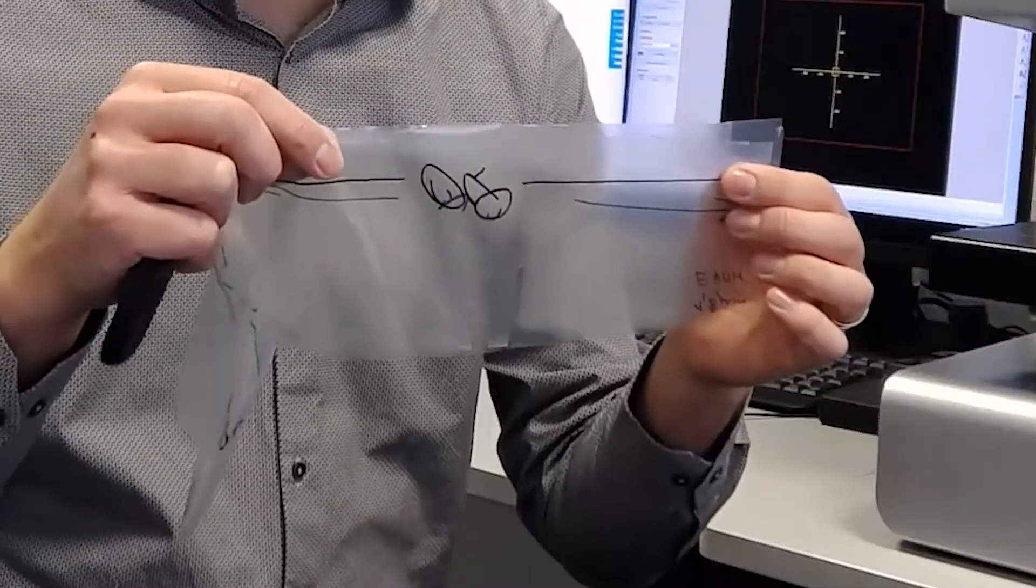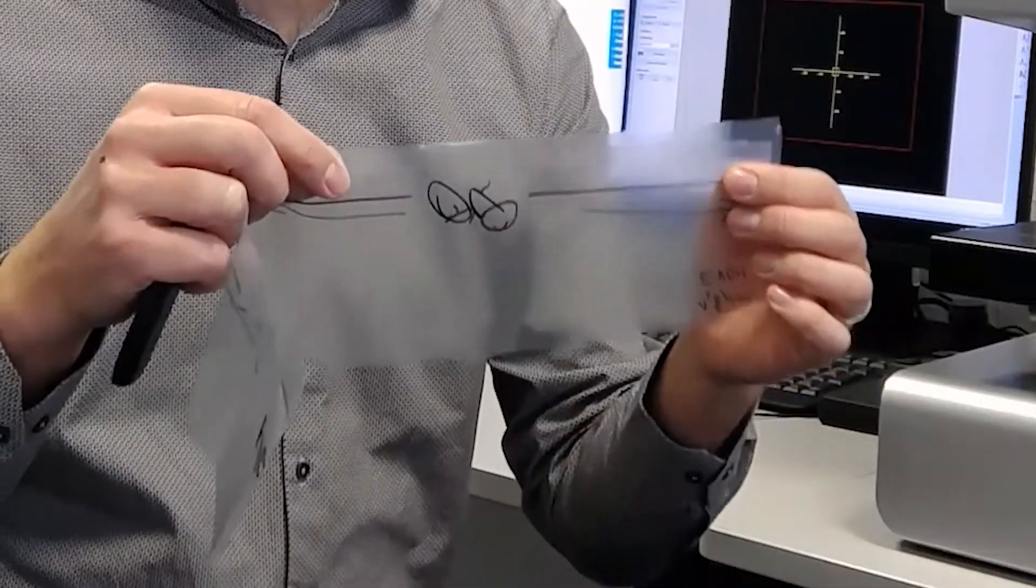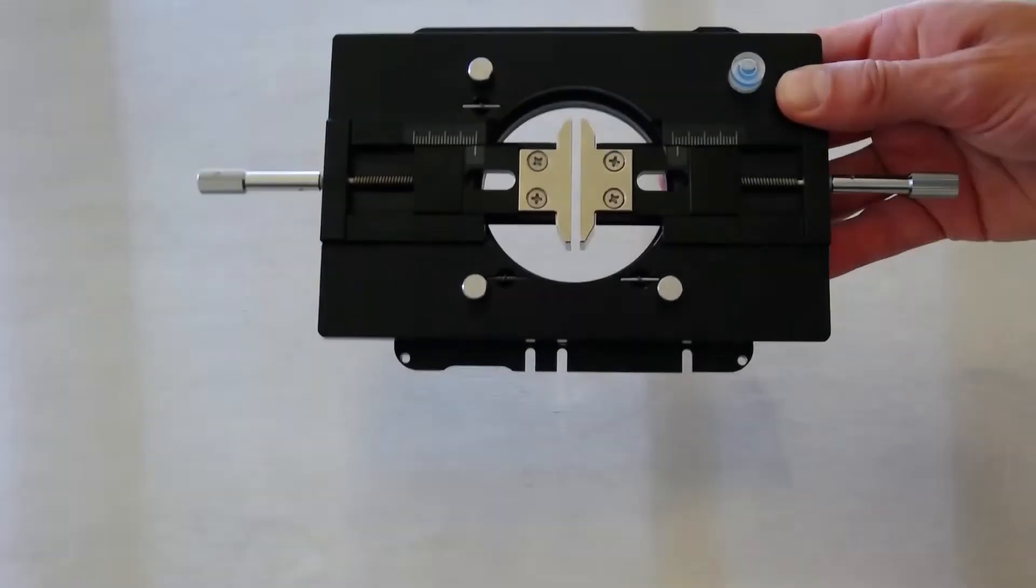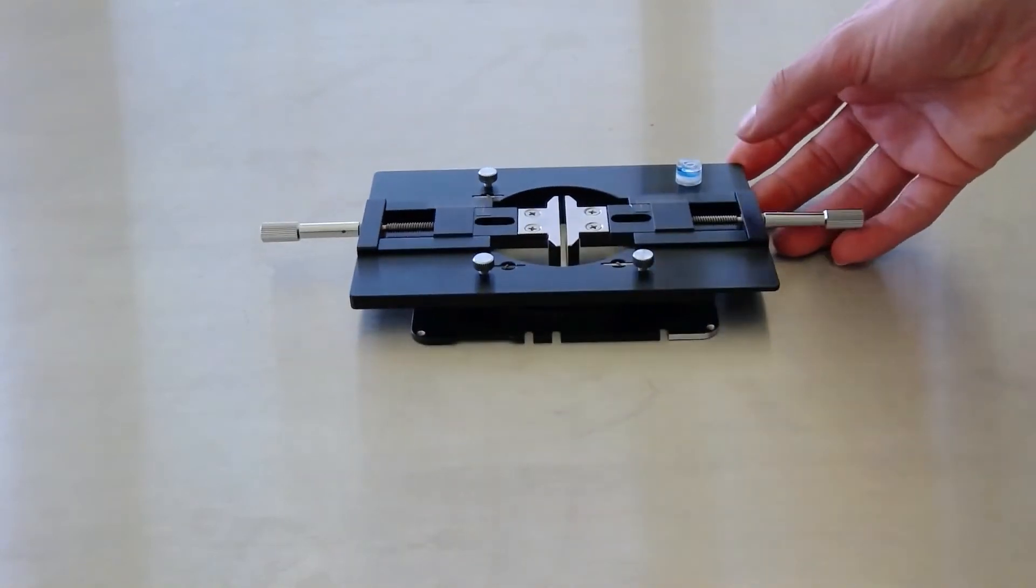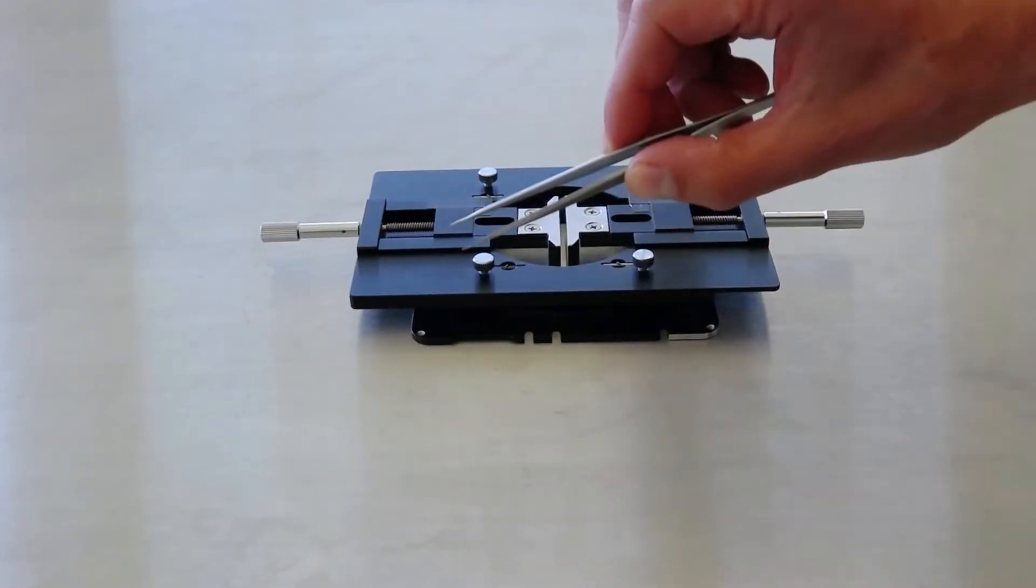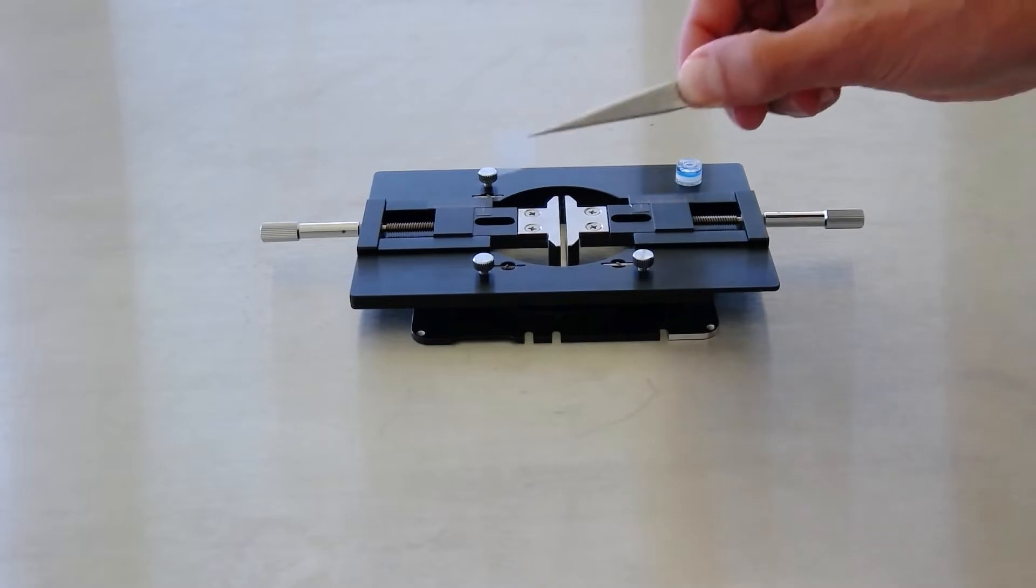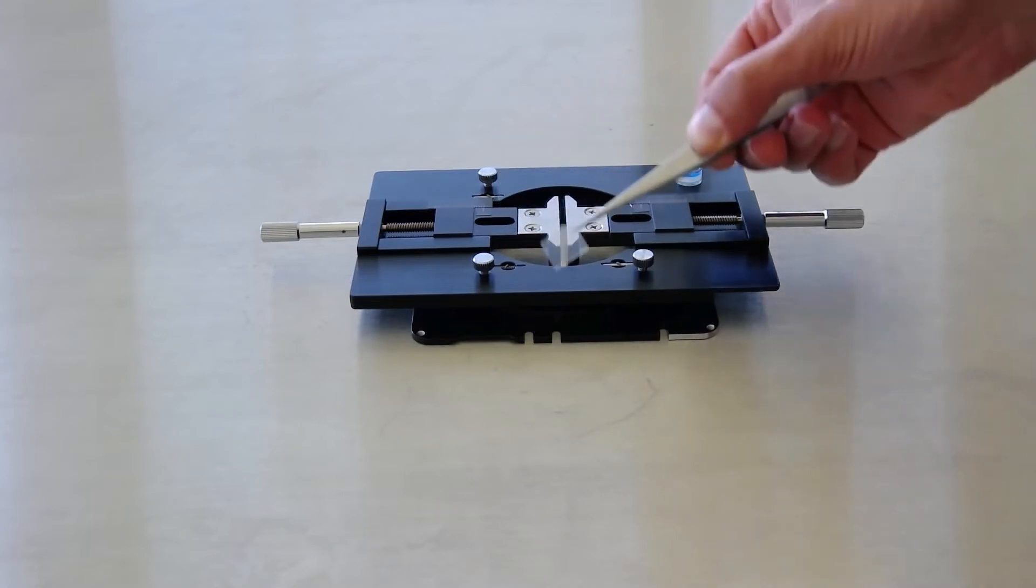In this video we want to find, verify and evaluate that layer. For this we have to prepare the sample using a special microscopy accessory. Additionally we need a pair of tweezers, a piece from the foil and PTFE spacers.